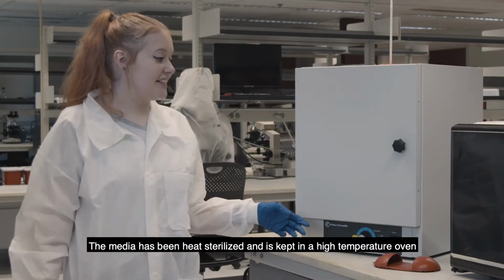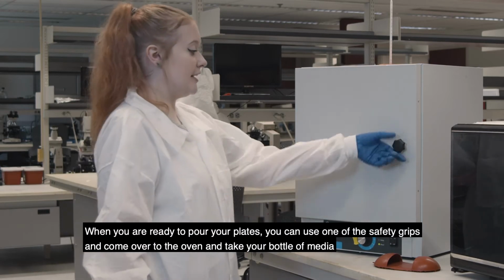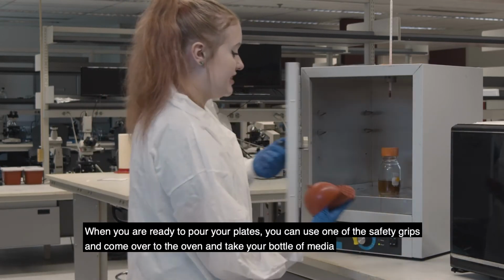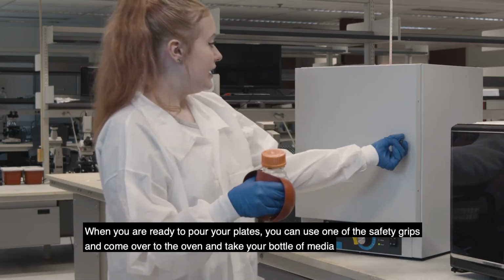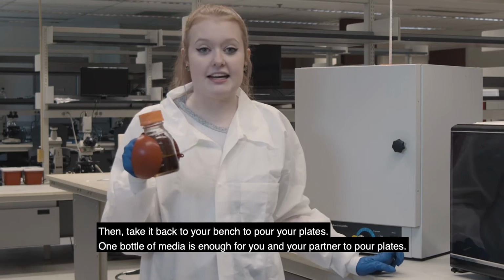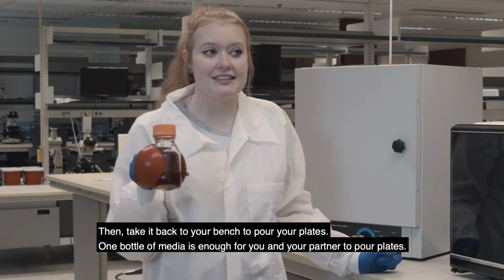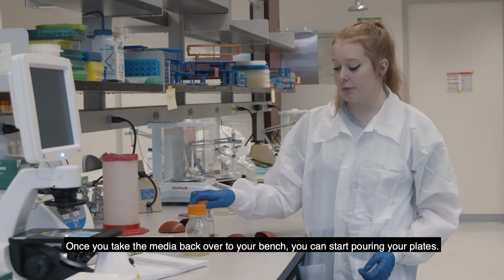The media has been heat sterilized and is kept in a high temperature oven. So when you're ready to pour your plates, you can use one of your safety grips and come over to the oven and take your bottle of media and then take it back to your bench to pour your plates, and one bottle of media is enough for you and your partner to pour plates. Once you've taken the media back over to your bench, you can start pouring your plates.